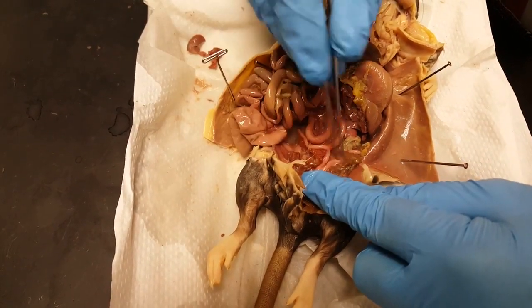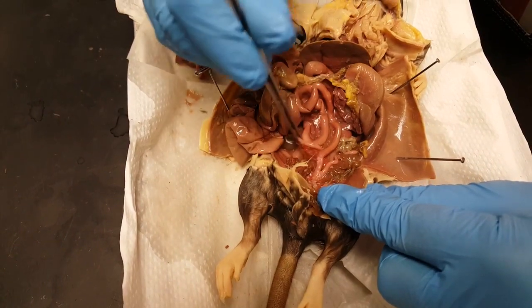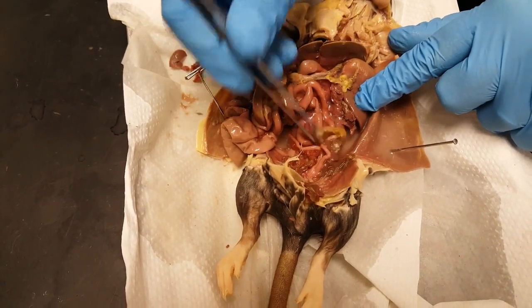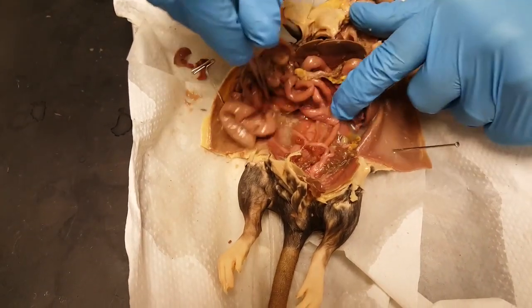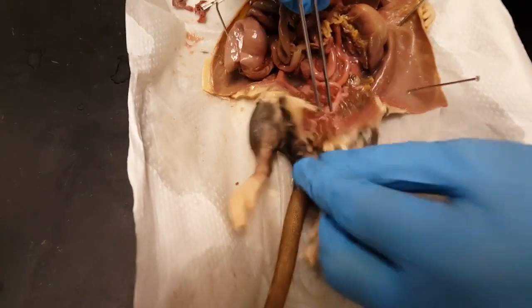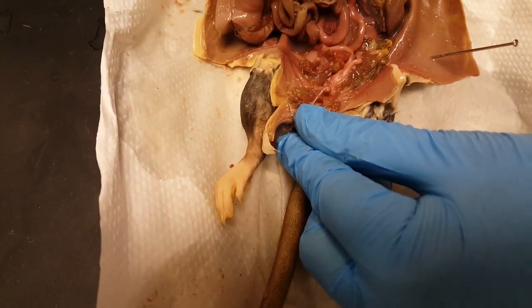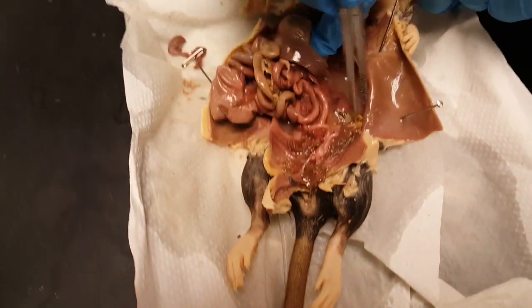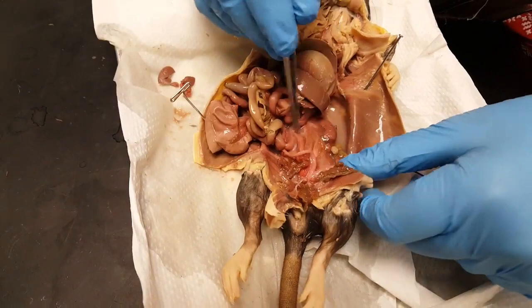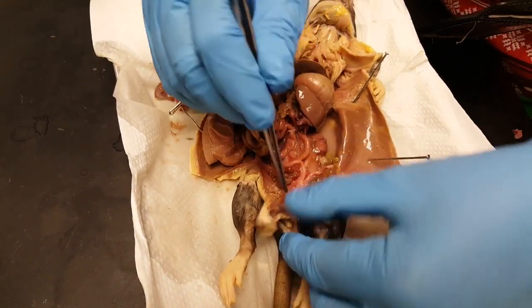These two little tubes — don't get those confused — those are actually uterine horns and are part of the female reproductive system, and you can even follow those up and get to the ovary. This little nub right there is the urinary bladder, and it connects to the kidneys here. Sometimes you can find the ureter, which is the little tube that leads from the kidney down to the bladder.